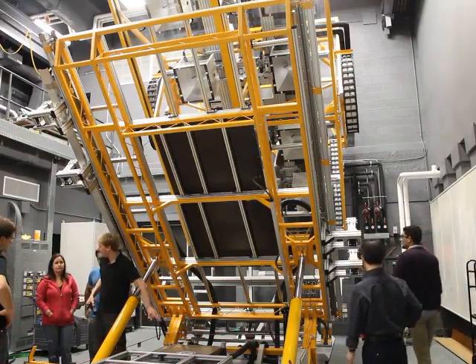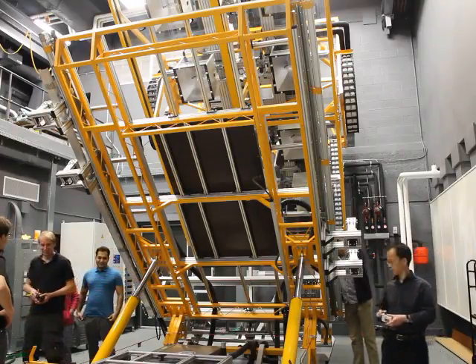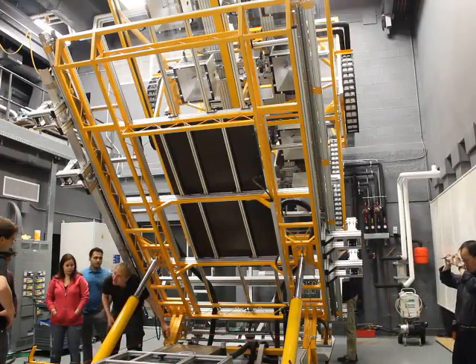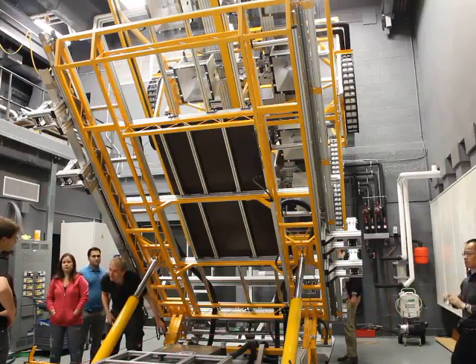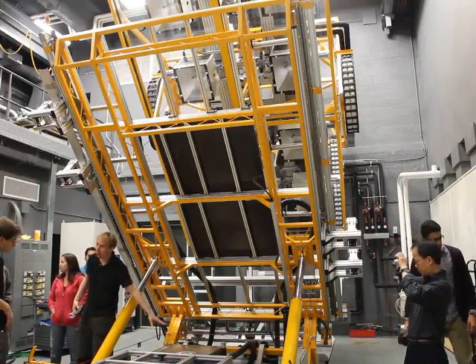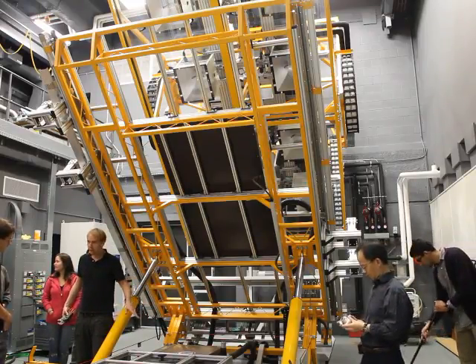Otherwise, you will have to drain everything as well. You don't want to do that. Here, it looks like water, so don't fill in water there. What is it? It's oil. Yeah, we have this. The machine works. It has an oil circuit in there for controlling the temperature.